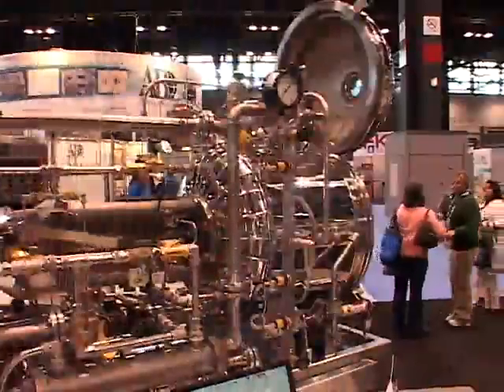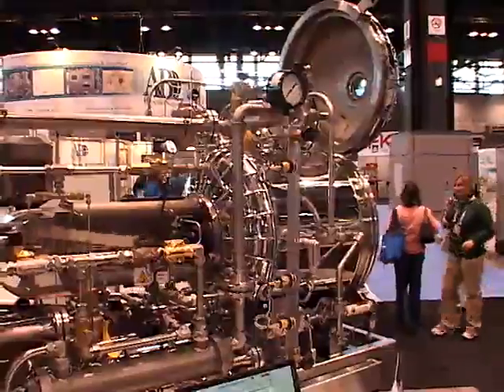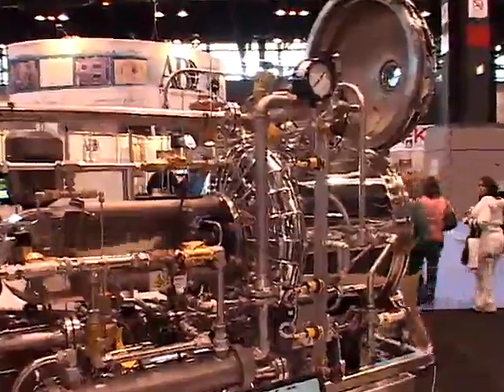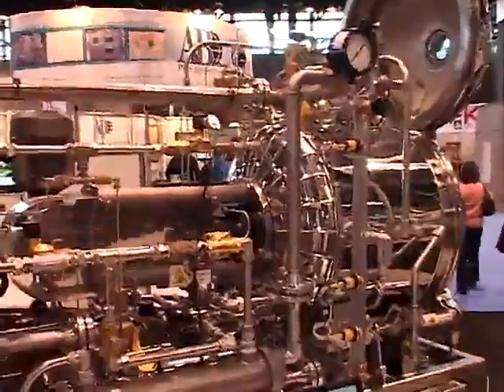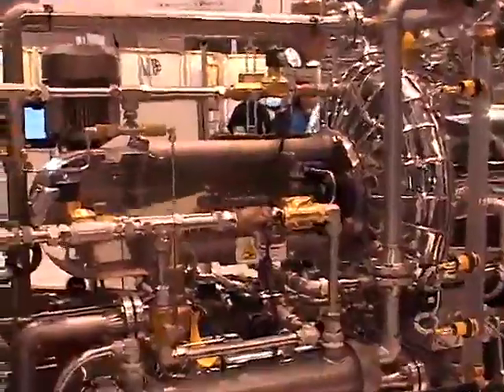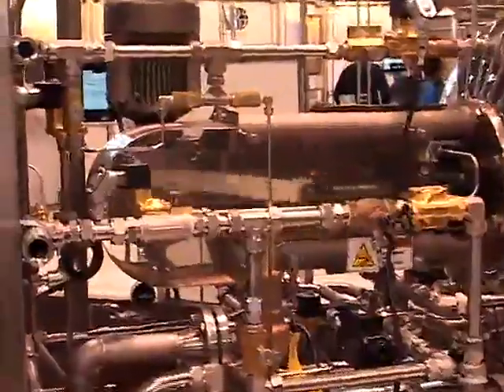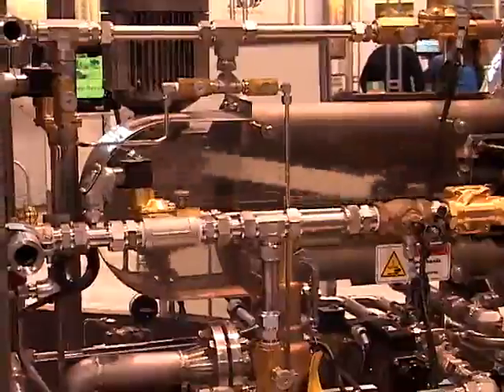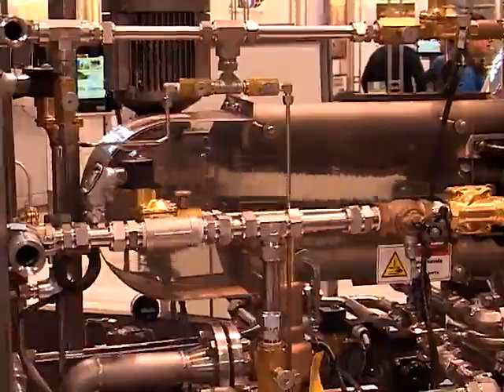The processes that the 2402 Flex machine will run are saturated steam, force spray, water cascade, water immersion, and hydrostat simulation.